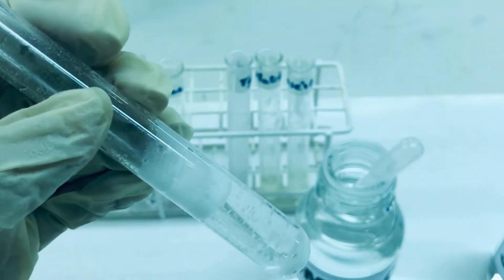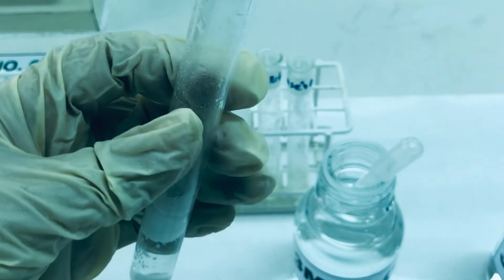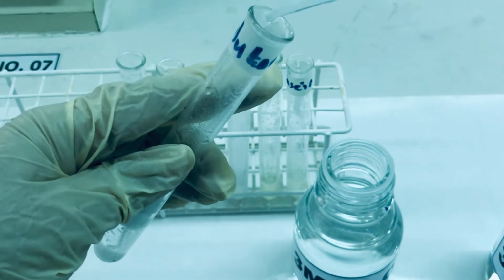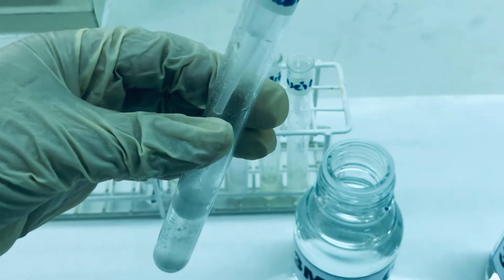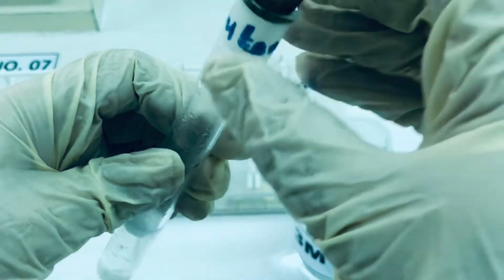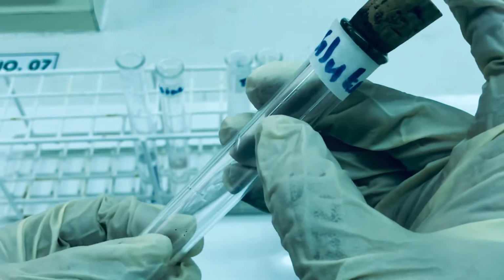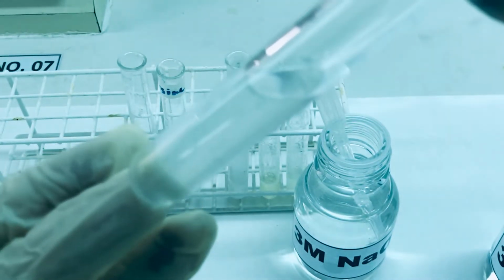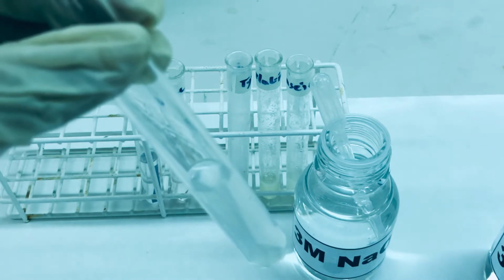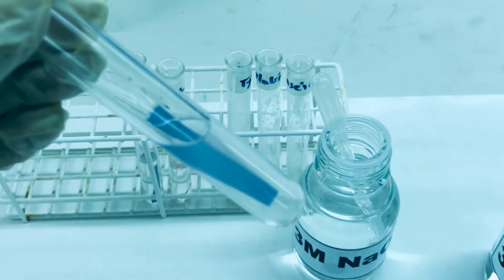As we had seen that glutamic acid was only sparingly soluble in water, we will now test the solubility as a function of pH. For the purpose, to this test tube, we will add 1 ml of 3M NaOH solution. We will put the stopper and shake it vigorously for 1 minute. As you can see, now the glutamic acid has become soluble. You can see a clear solution. To this we are going to add a piece of litmus paper. You can see the litmus paper has turned blue.